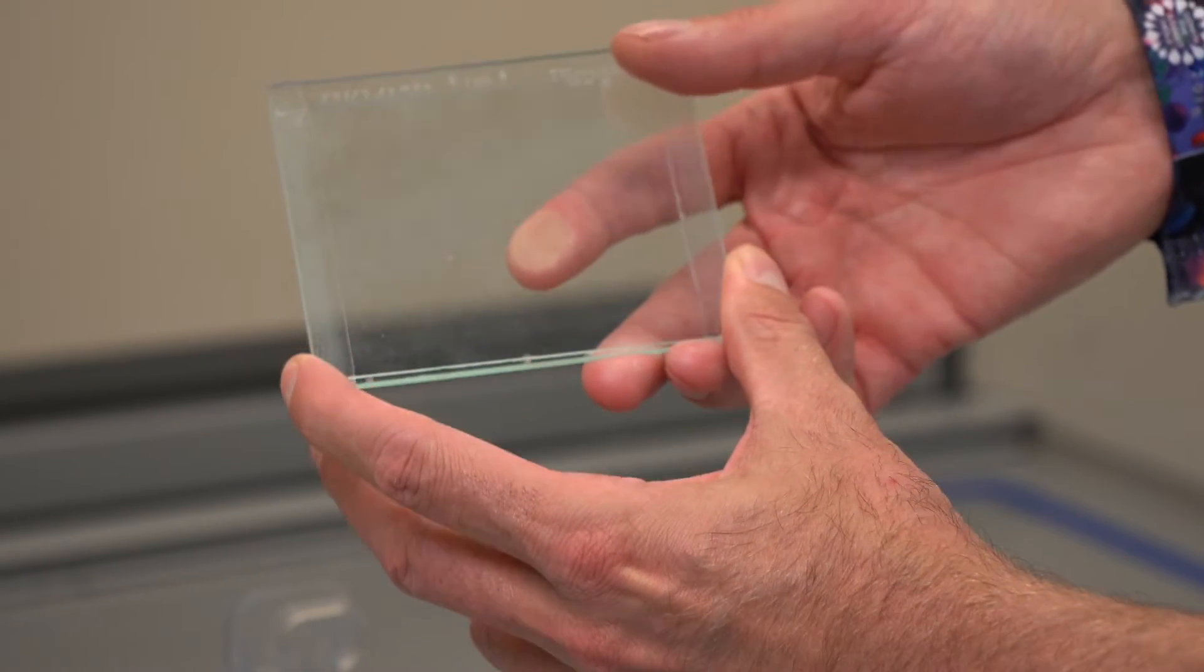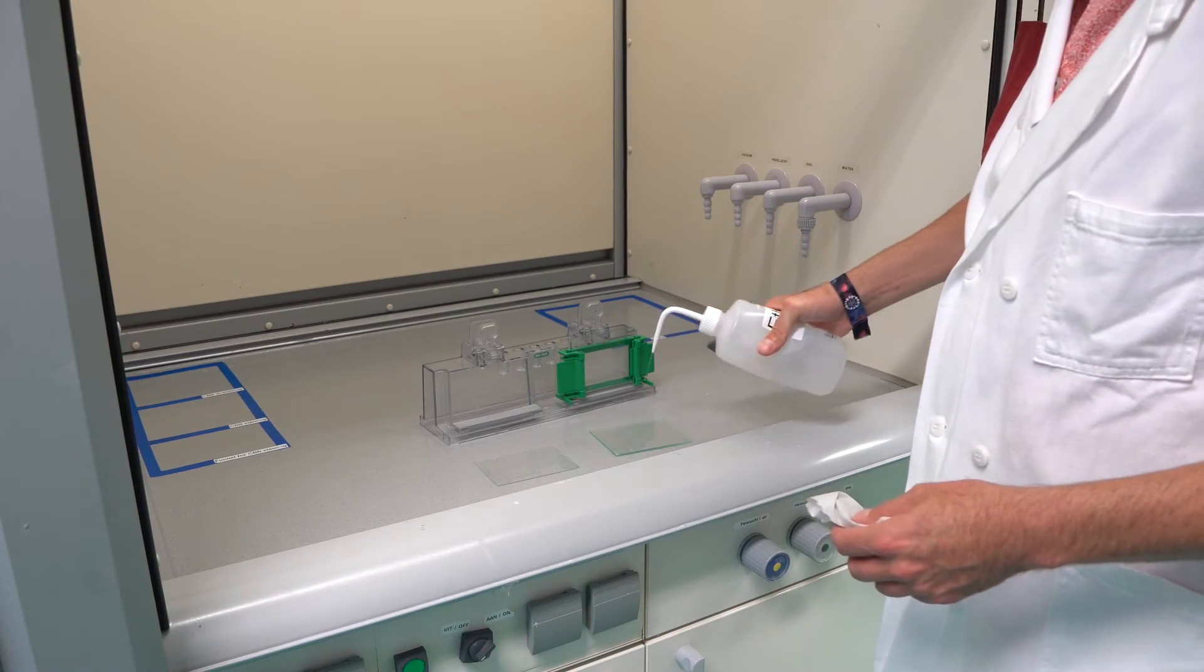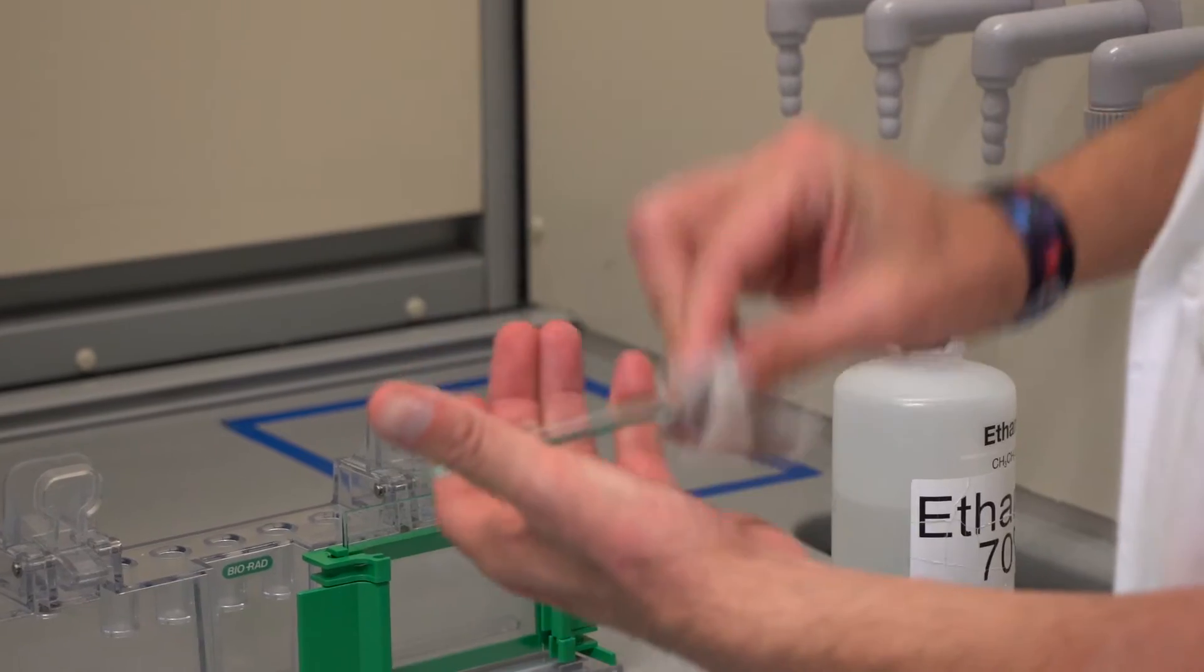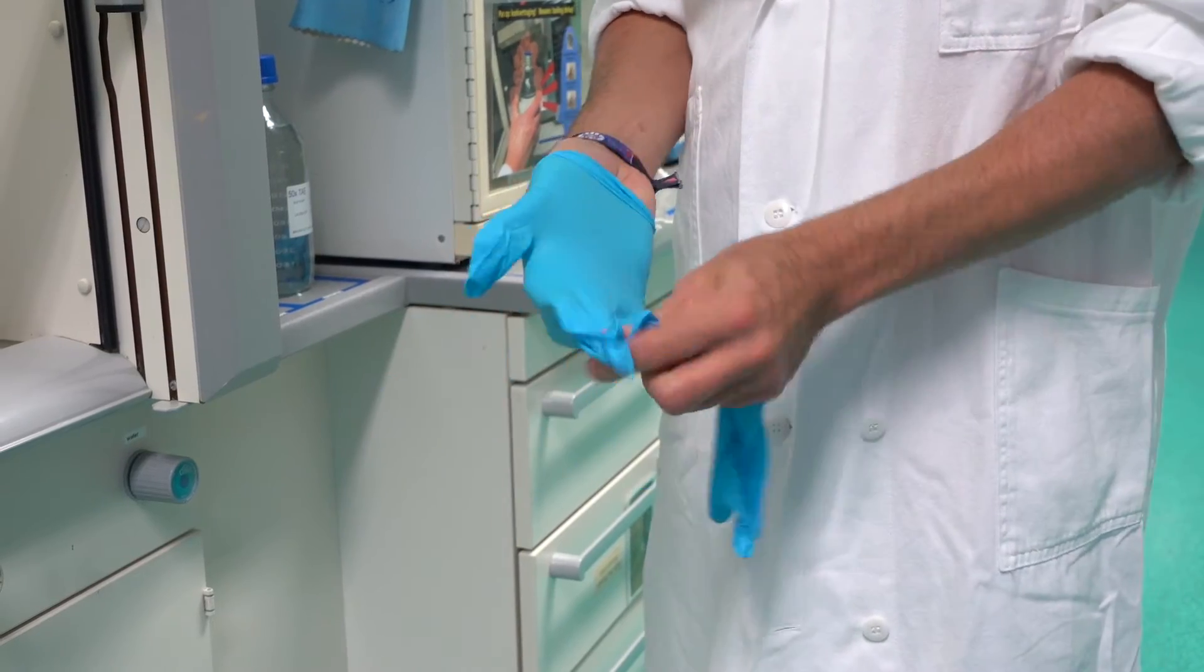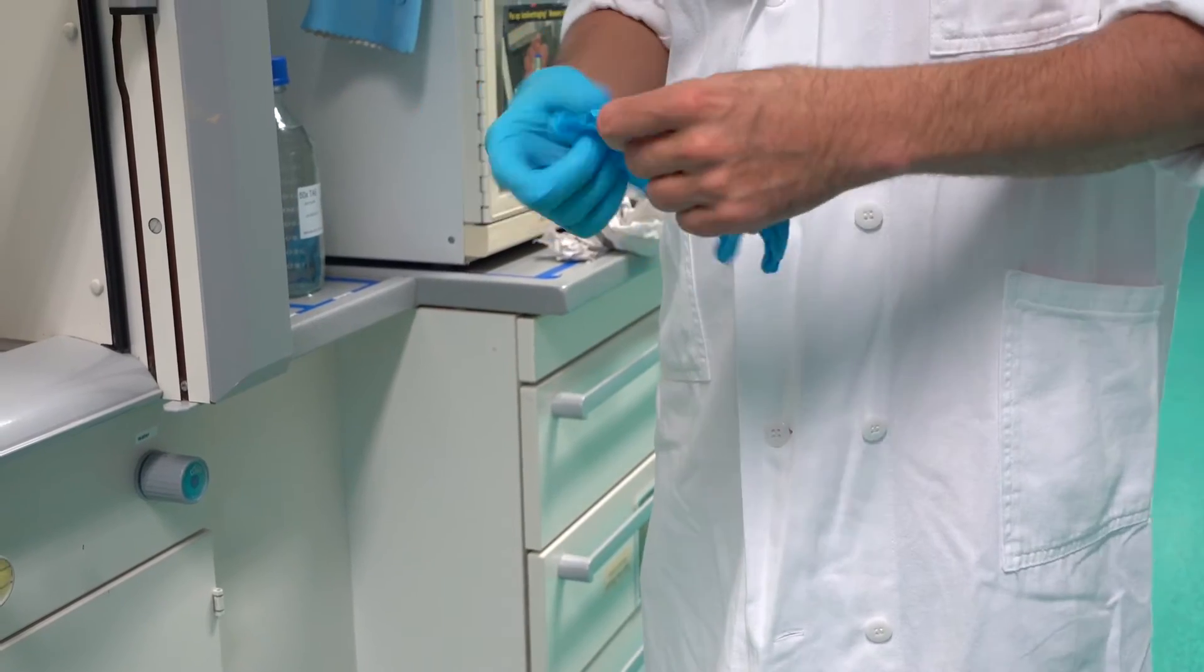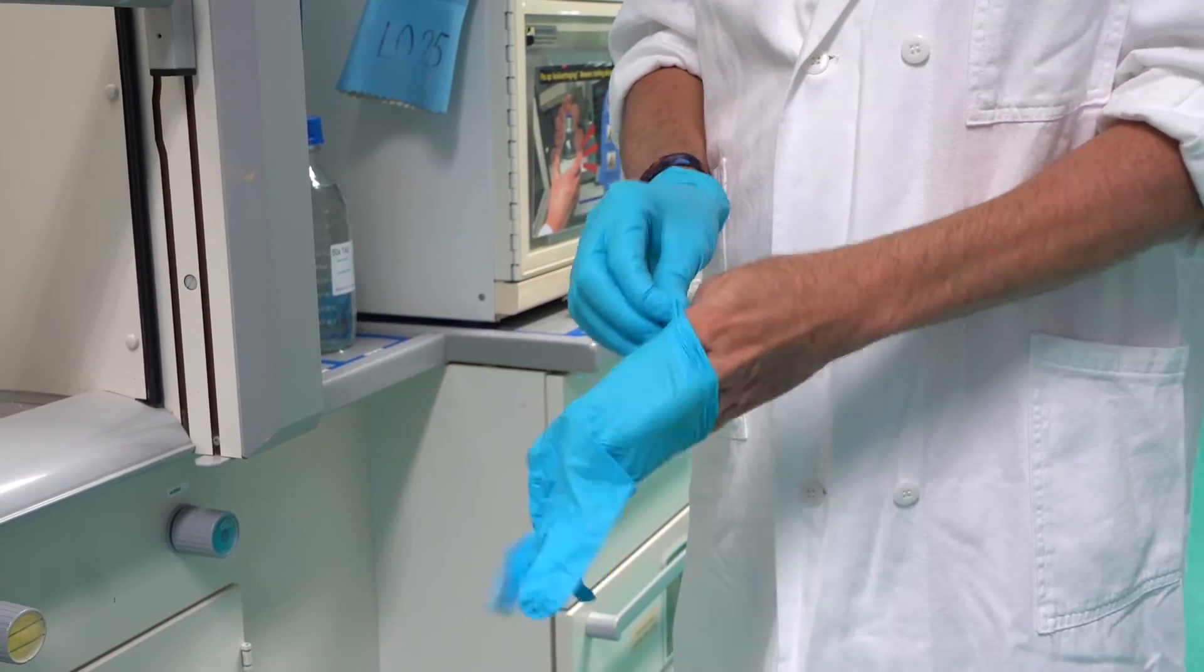These spacers provide the thickness of the gel. The short plate is slightly thinner and shorter than the spacer plate. The slides must be cleaned very well before use with 70% ethanol. Put on gloves. The chemicals that we work with here are very toxic, so be careful.